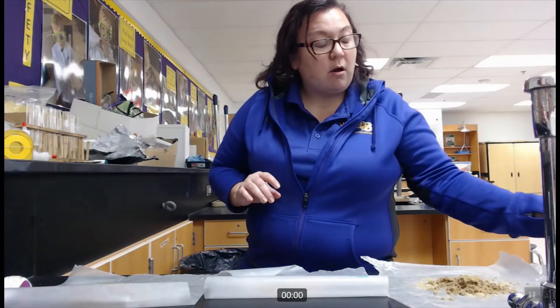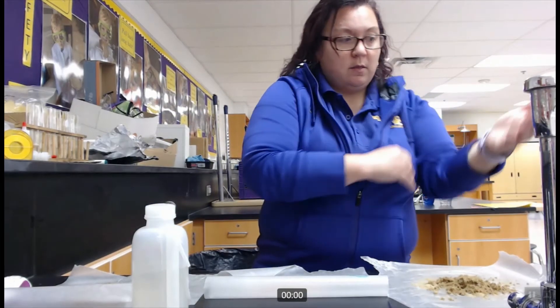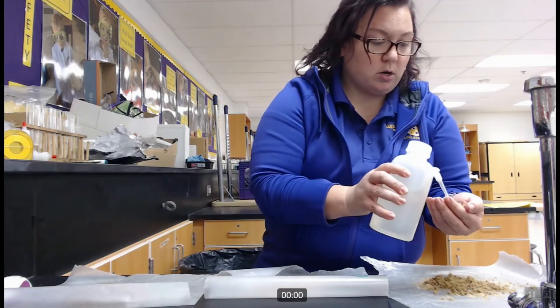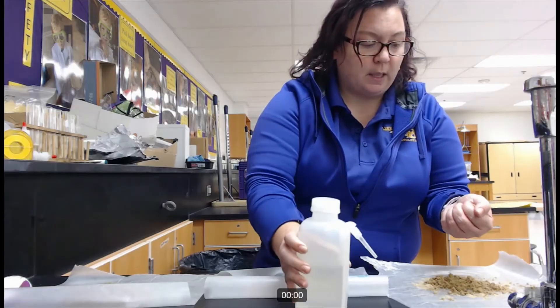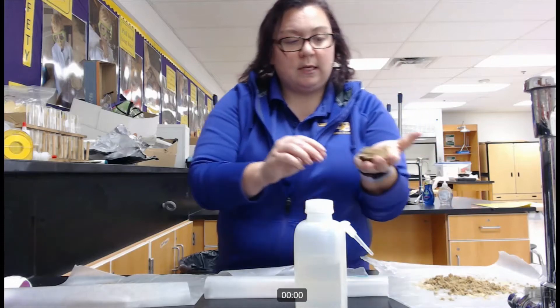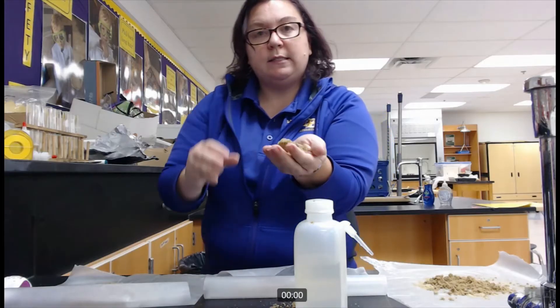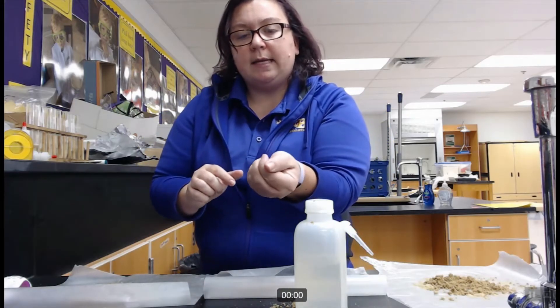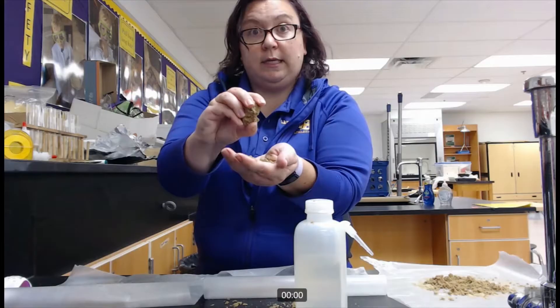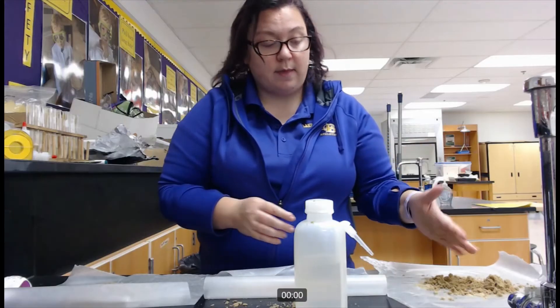When we are doing our analysis we take our dry samples, put some in the palm of our hand, add some water, knead them up, and the first thing we look at is that ball stage. When I squeeze this together, does my sample stay in that ball? We can see that even though it is moist and I can squeeze it together, that ball shape is not holding itself together. Based on our flowchart, that is actually the only test we need to run on that control.